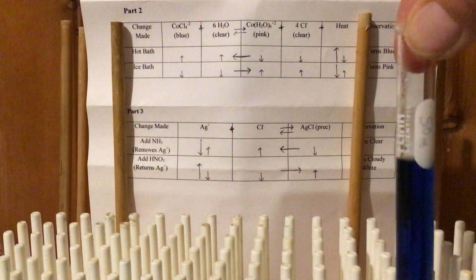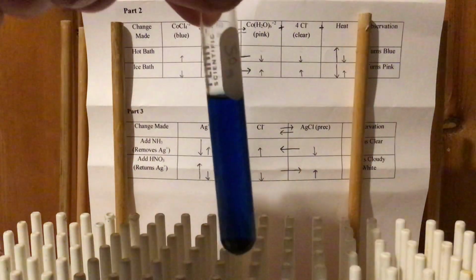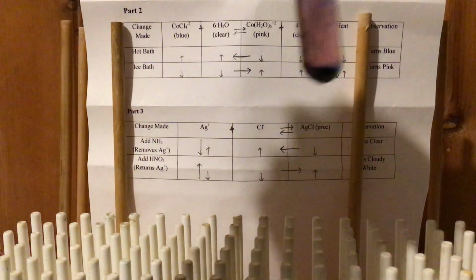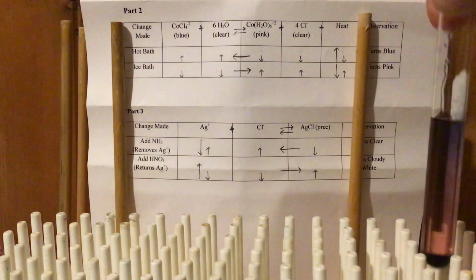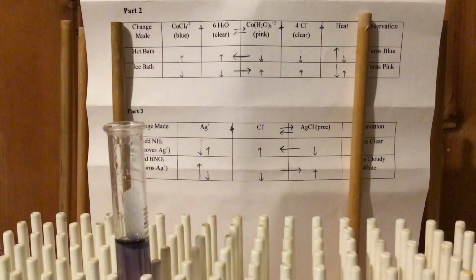It turned like this. And I just want to do one other experiment where I add a little bit of water to this and watch what happens. So I'm just going to add some pure water because this is sensitive to temperature, but it's also sensitive to moisture. So I'm going to squirt some water in here and watch what happens. It gets pink. And I look at this system and I can say, why would that get pink by adding water to it? I'm going to throw that right in there.